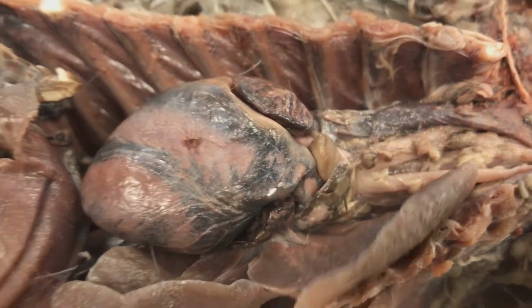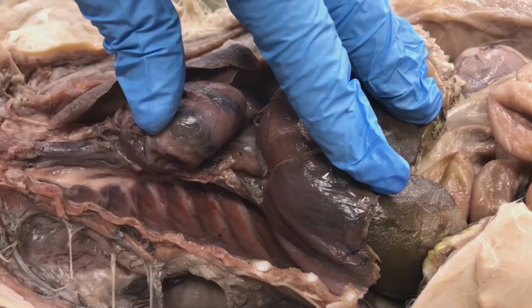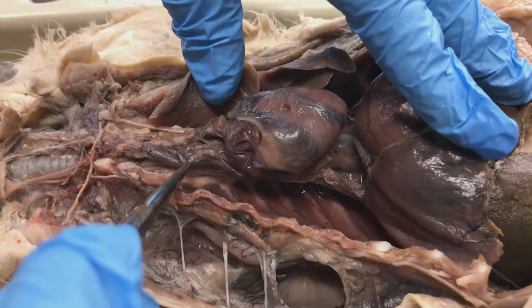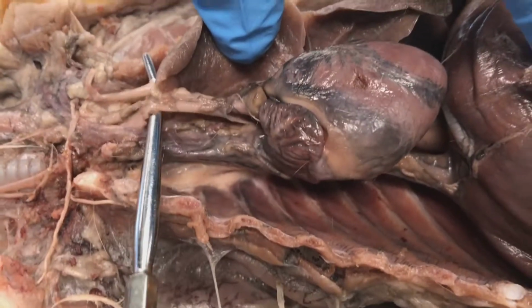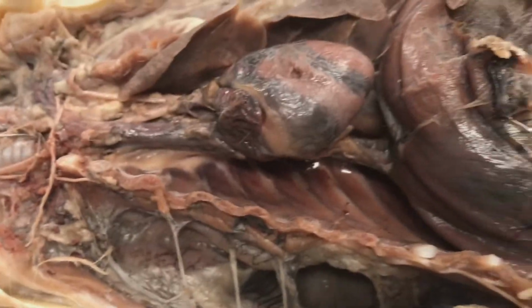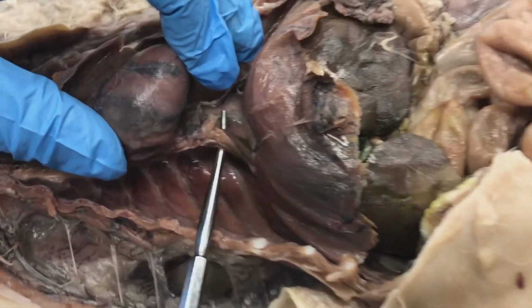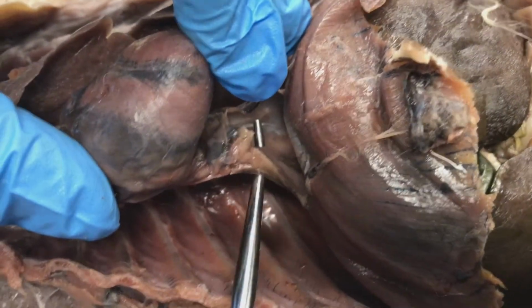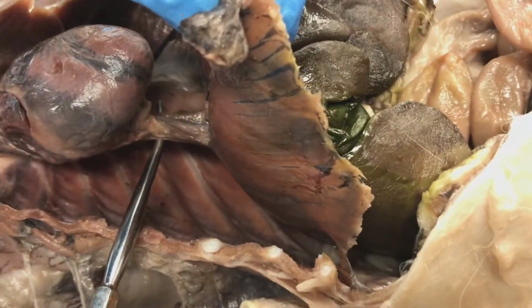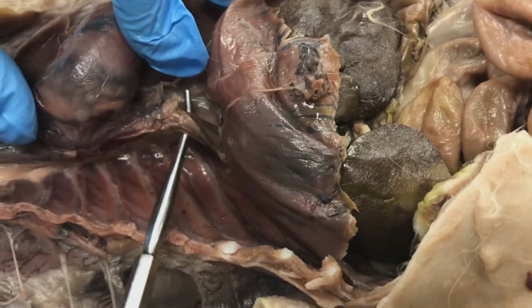So the veins on the body look dark because they force the blood into it, and then your arteries look pale because they force the blood away from it. So on your heart, you have the blood going from the lower part of the body through the vena cava, and this right here is my inferior, or rather in cats, it's the posterior vena cava, and it passes through this, which is my diaphragm. So that's my posterior or inferior vena cava.